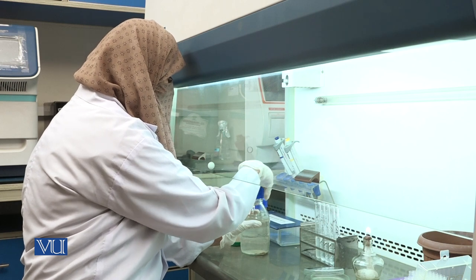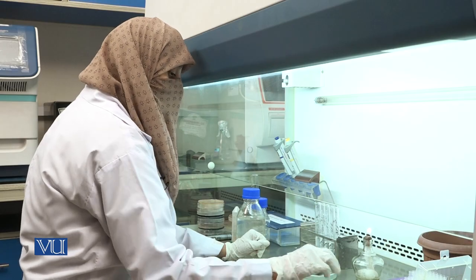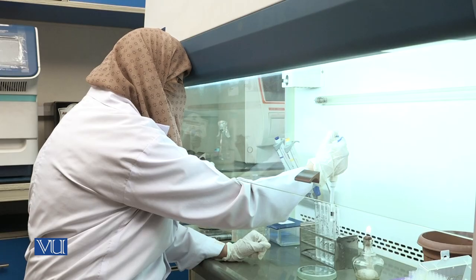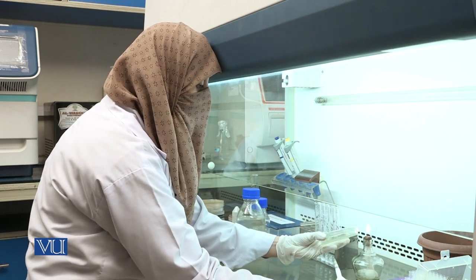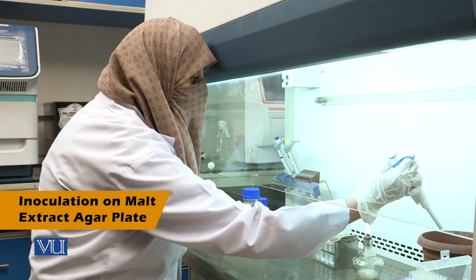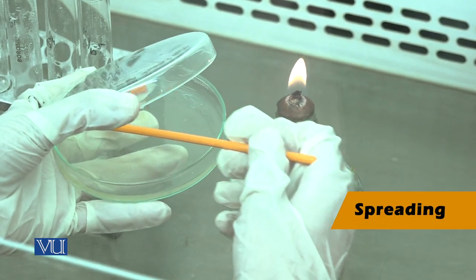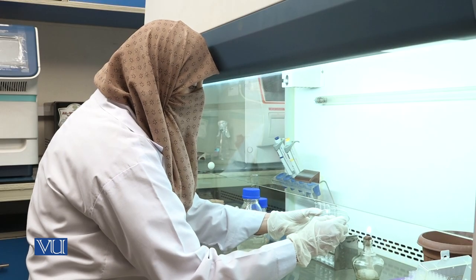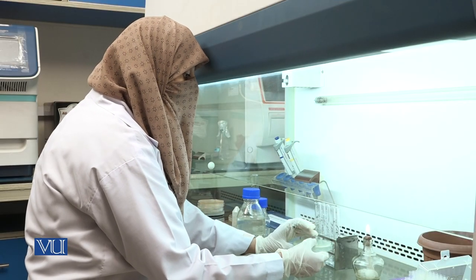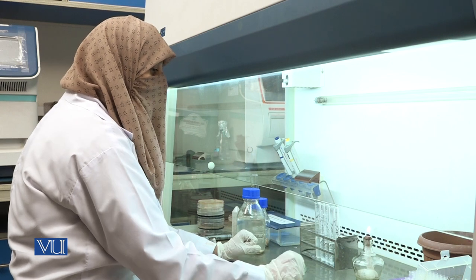For inoculation, a malt extract agar plate is prepared. Inoculate from 10 to the minus 4 dilution and pour the inoculum onto the malt extract agar plate, spreading it lightly over the surface of the agar. Once the inoculum is fully absorbed, place the plate in the incubator for 2-4 days for isolation of Aspergillus niger.